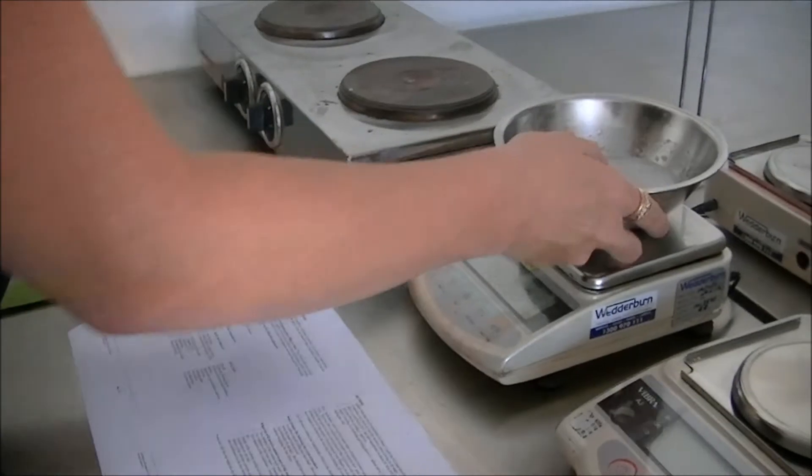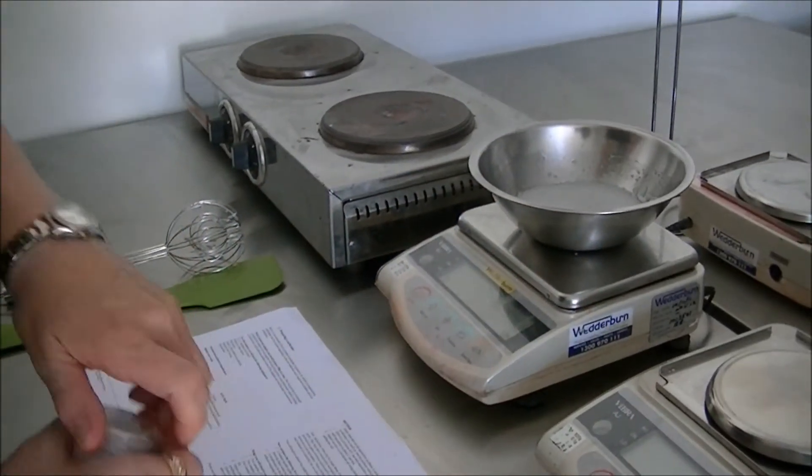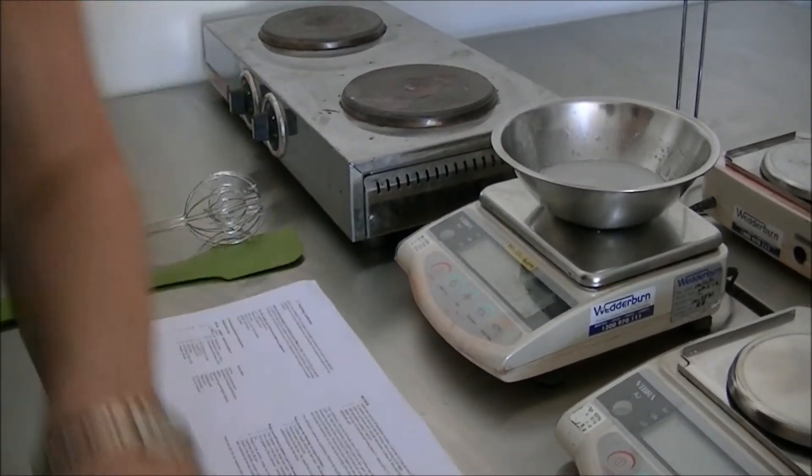Now I'm just going to add the phase C materials. And then I'm going to talk you through a very important step with pH adjustment.